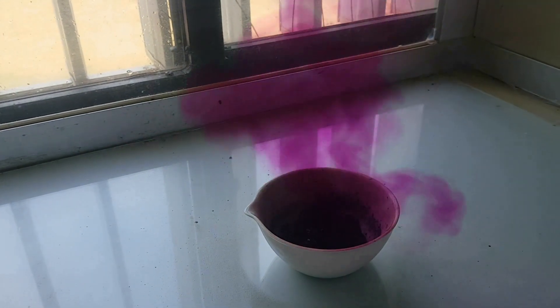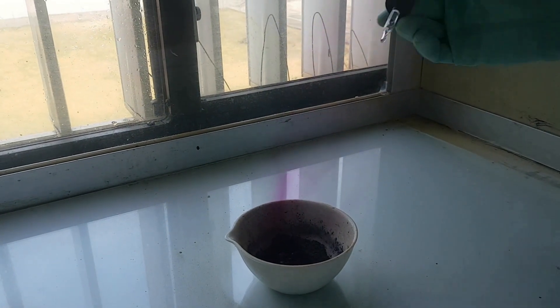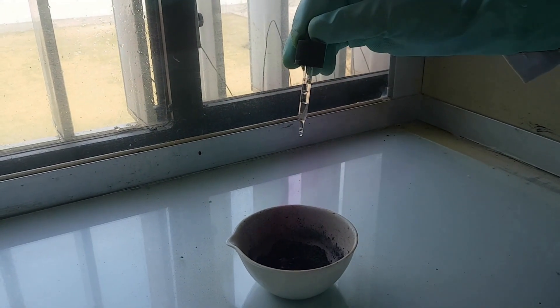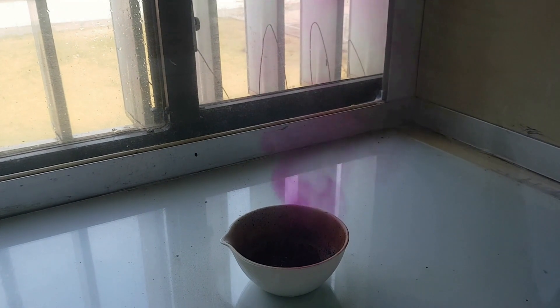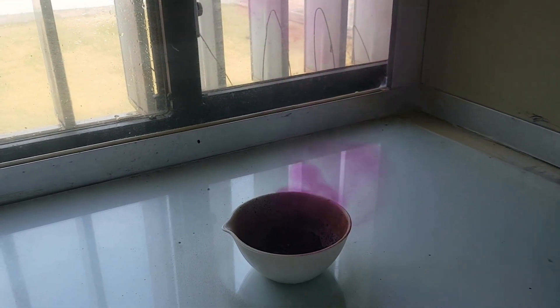A violet gas is released. It is sublimated iodine. Some of the iodine sublimates thanks to the heat of the reaction that has already started.